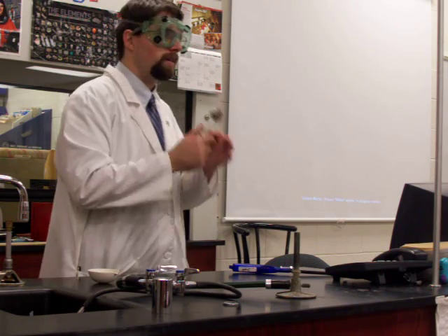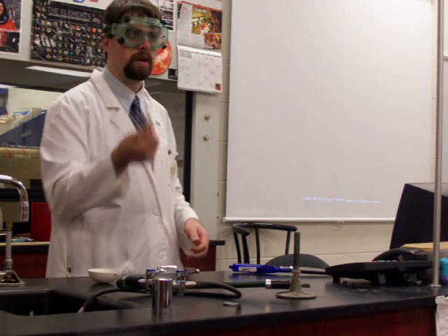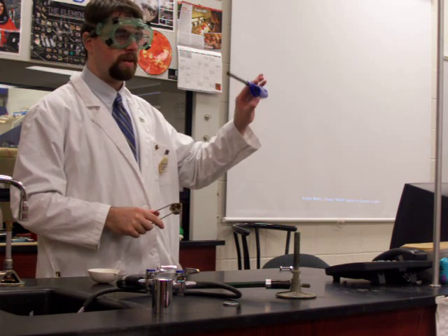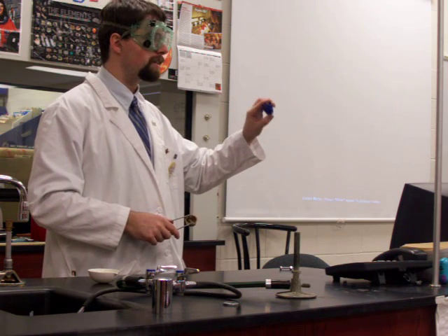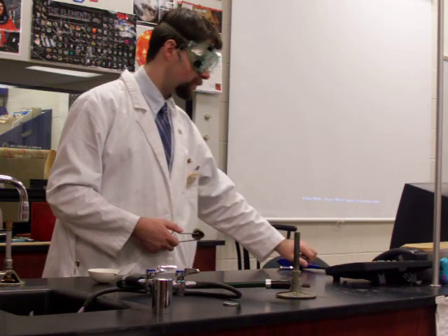So how to light it? We'll use strikers primarily. It's actually advisable to use a striker or a match. These are safer, simpler, and cleaner. You can use another igniter like this. The downside is you are adding an extra fuel source. That's kind of a potential hazard.